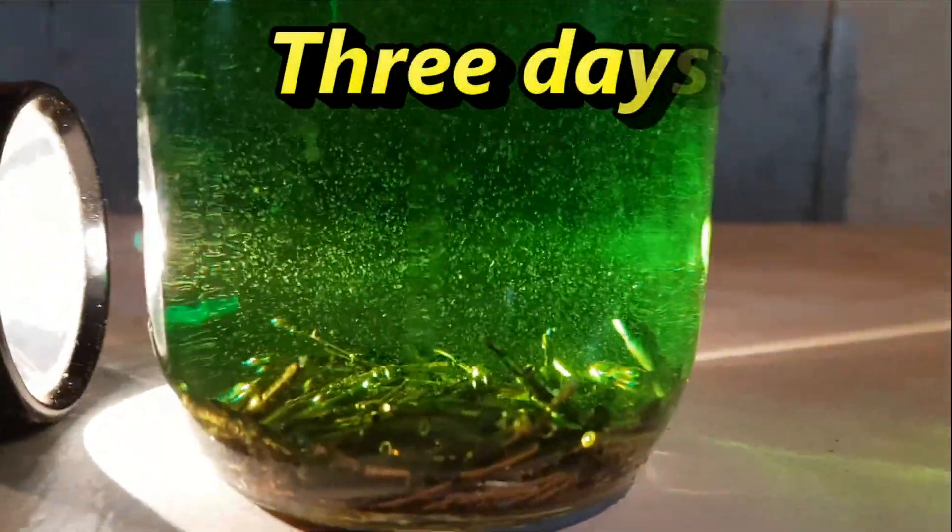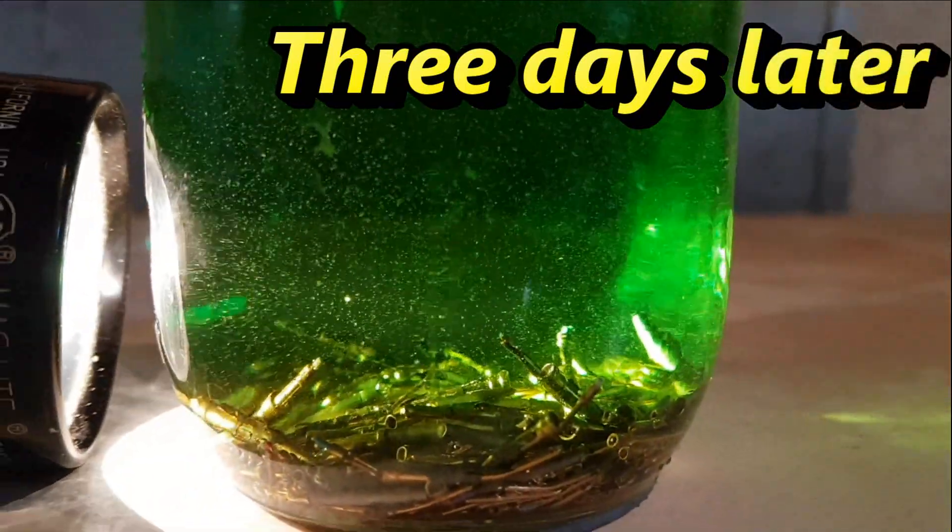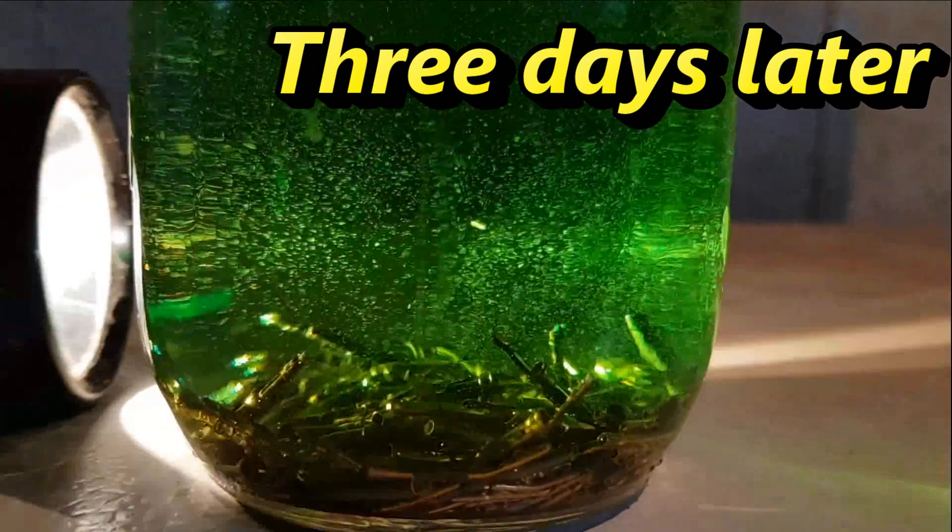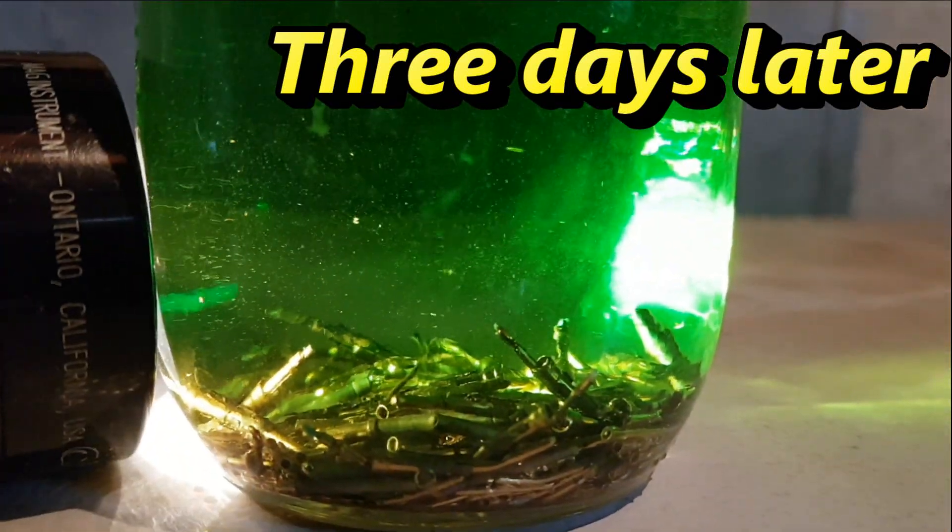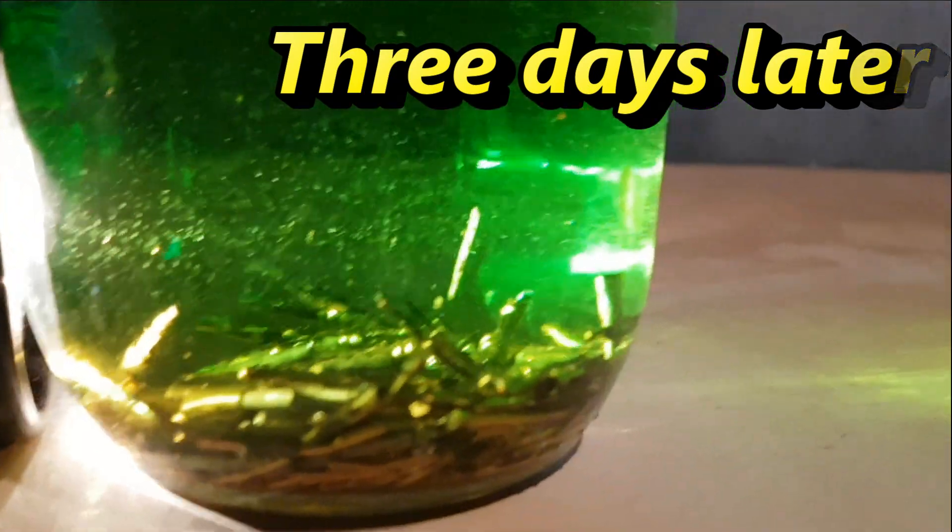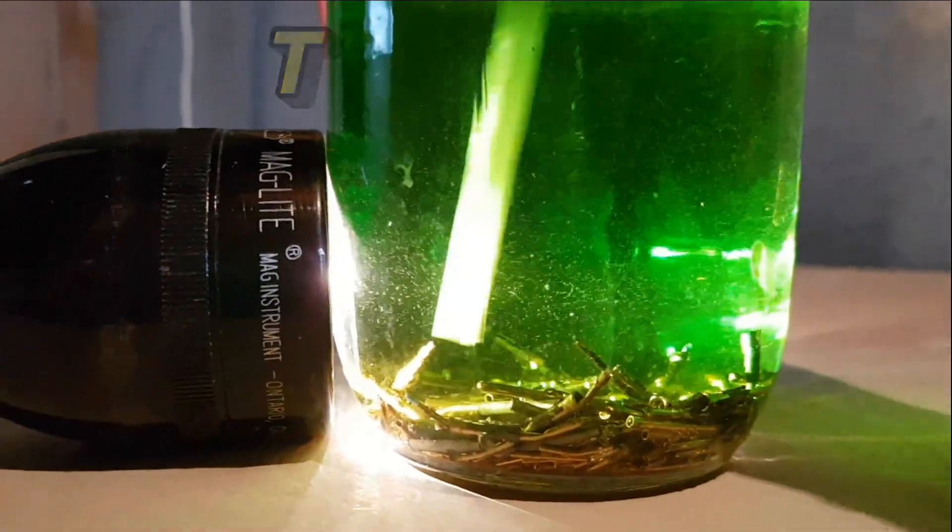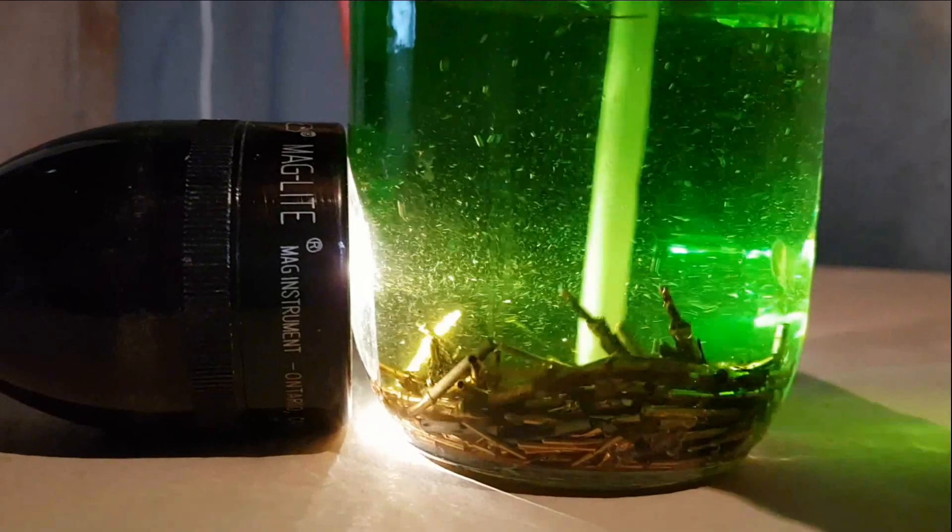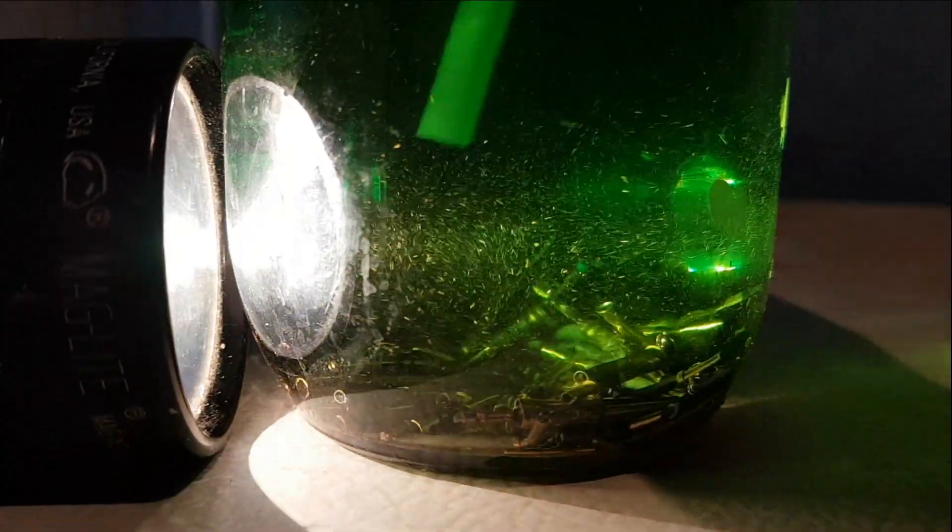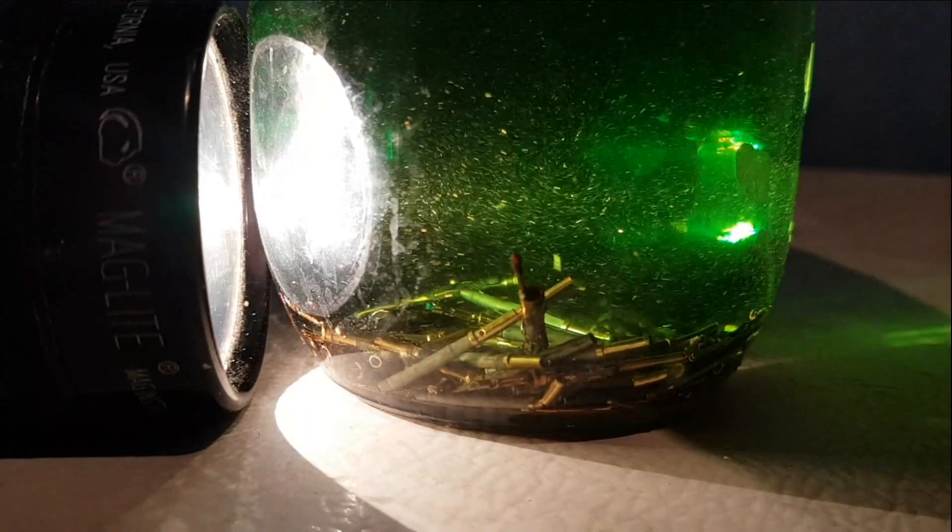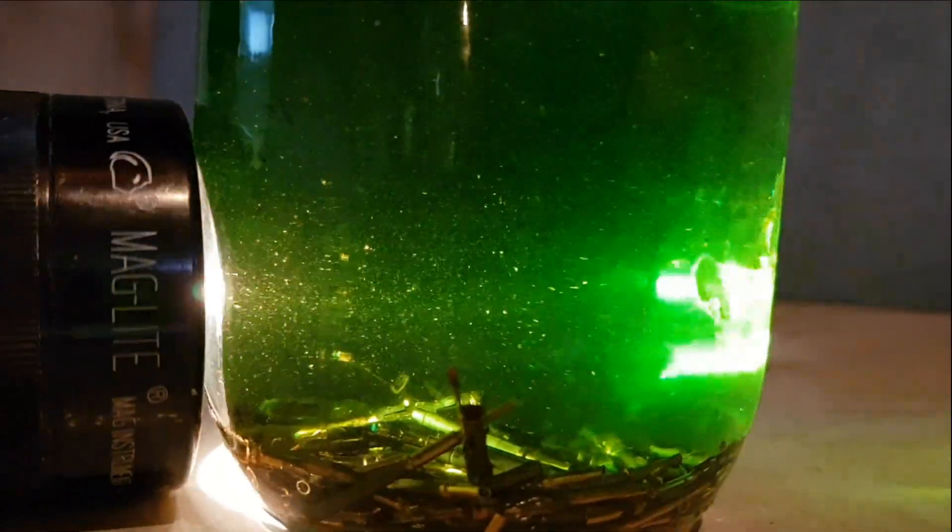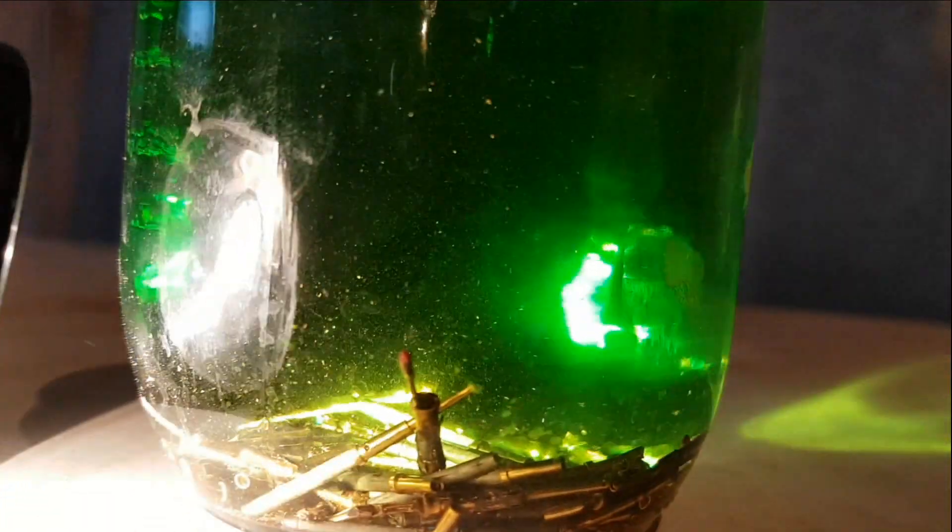Three days and counting. At least now we're seeing a significant amount of progress. There's still a lot of bubbles in the solution and still a lot of material left to be taken care of. But we are seeing a fair amount of flakes of gold up in the solution. We're going to go ahead and give this a bit of a stir and hopefully you'll be able to see what I'm talking about on the video. So it's obvious that the process isn't finished yet but we are a lot closer to that finish line than we were.